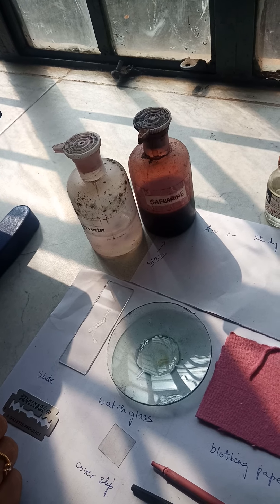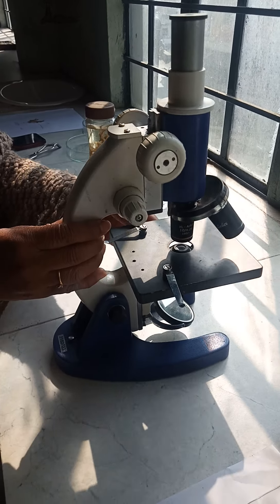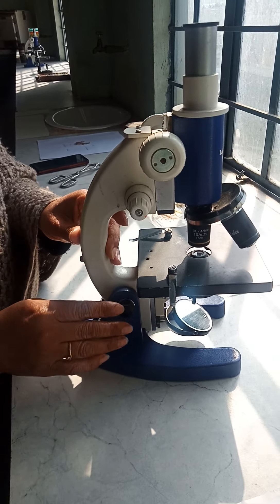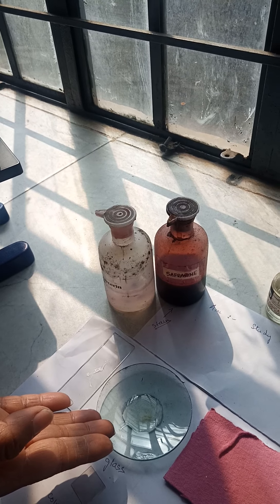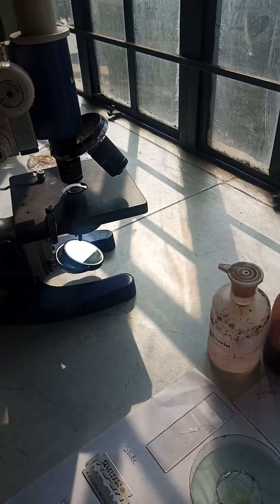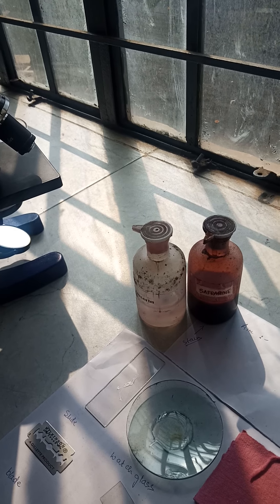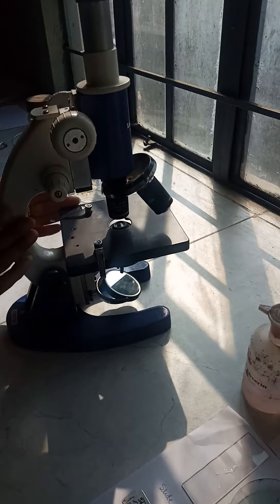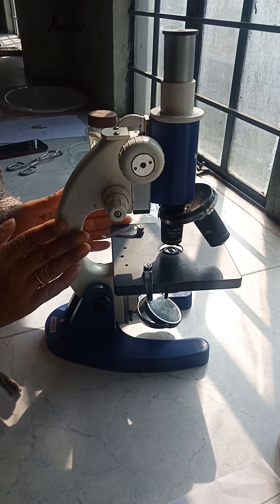Now we come to the most important part — without this you will not be able to see the specimen. As mentioned, algae is microscopic and difficult to see with the naked eye, so you will need the help of this compound microscope.